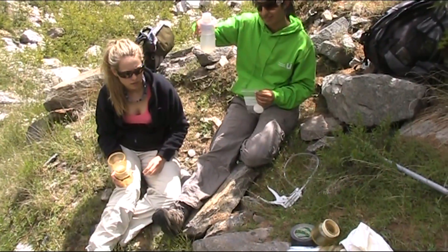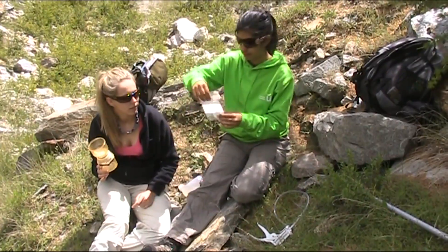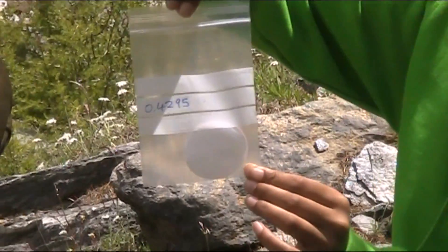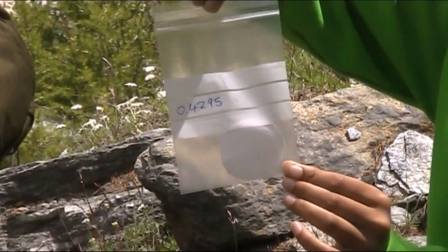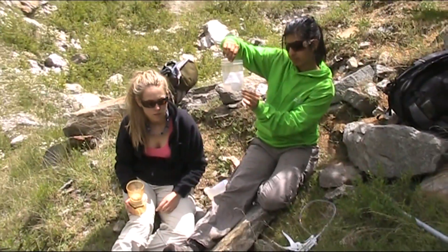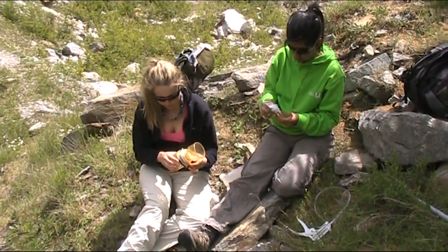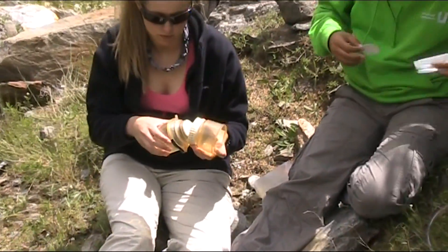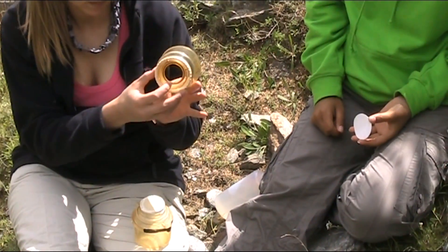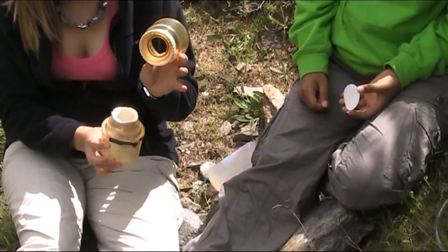The first thing to do is to assemble our filter paper into the housing. The filter paper is pre-weighed — we have a ziplock bag with the weight written on it in grams. It is very important that these filter papers are pre-weighed. We then remove the filter paper from the bag and install it into the housing. The housing unscrews with this white collar. There is a little rubber ring on the inside, which Rachel is just pointing out — that has to be there, and they sometimes fall out, so you need to check that.